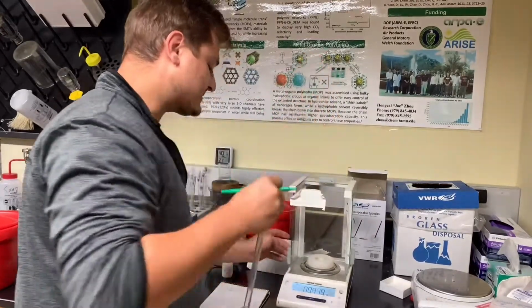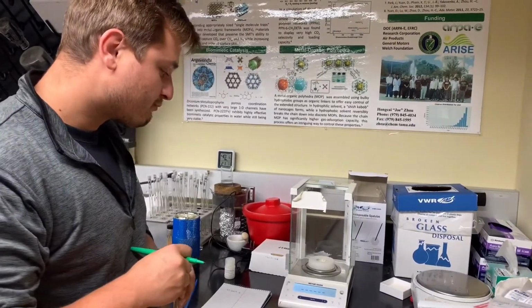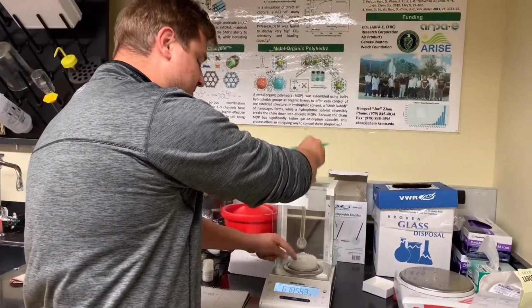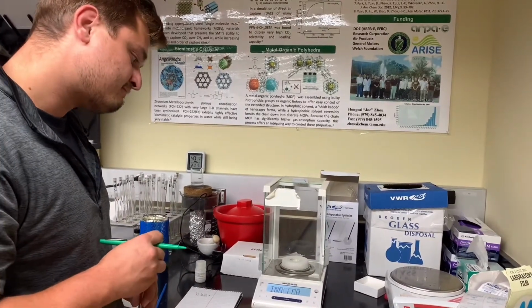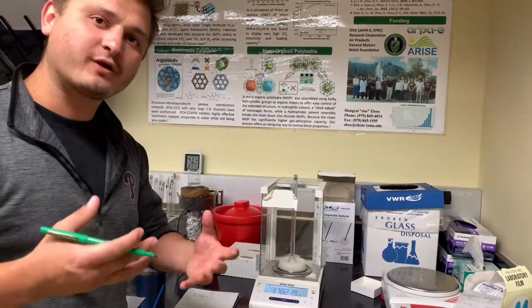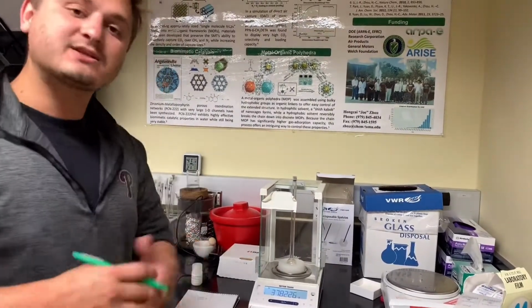We can open the side, take the tube out, hit 0 again, tare the scale, wait for it to go back to 0, and then get a second weight. And then we will do it a third time. We will take it off, we will hit 0. Again, we will wait for it to read all zeros on the scale. And then we will take the mass a third time. After we take the mass the third time, we will average all 3 masses together in order to get the actual mass of the sample tube. This is a way that we make sure we are as accurate as possible when getting the mass of the tube.